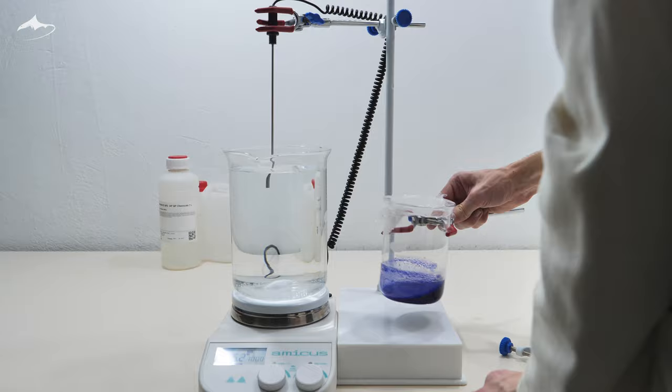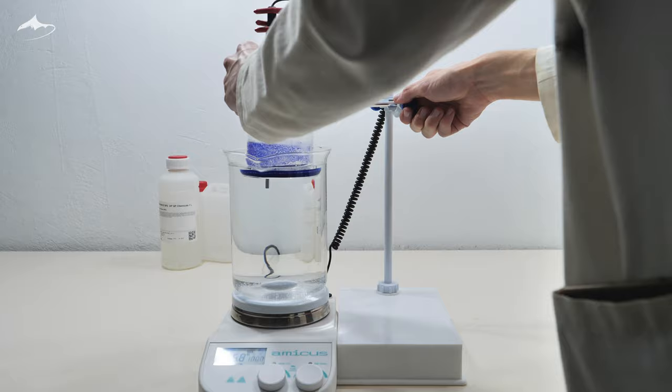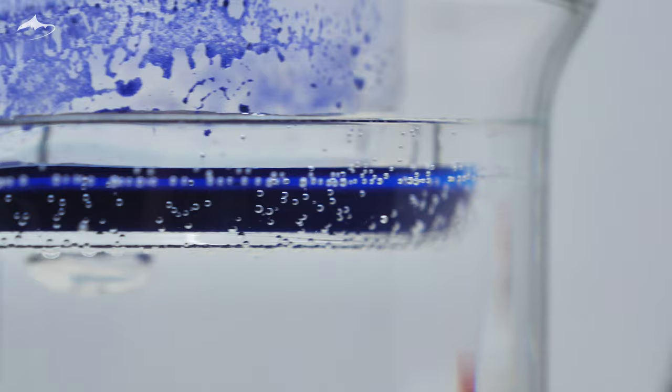Luckily for me, the clamp was just large enough to hold the beaker at its maximum aperture so I could place it in the water bath very easily. There was no need to fully submerge it in the water bath. As long as it is touching the hot water, it is more than enough for this purpose.